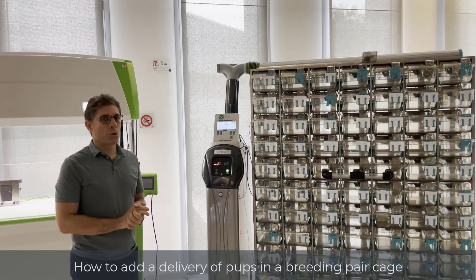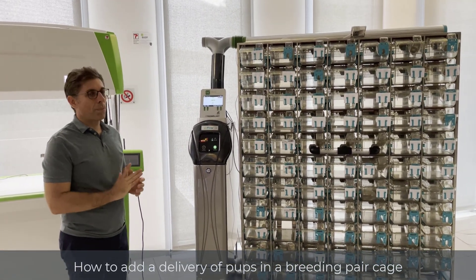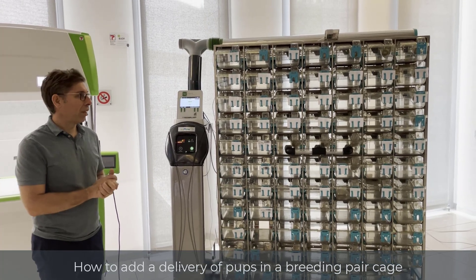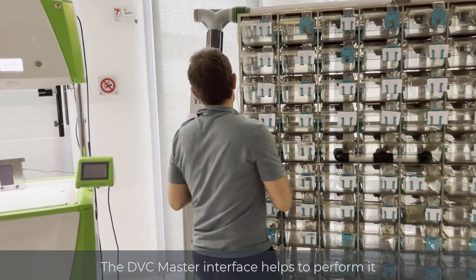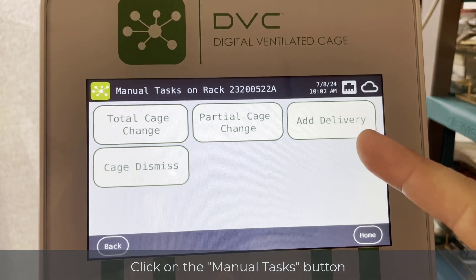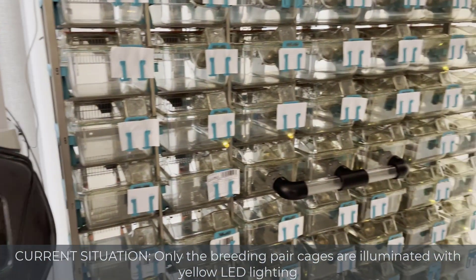In case you want to manually handle the potential delivery of pups in breeding pair cages, there is the opportunity to do it manually — whether you are anticipating the outcome of the temporal algorithm for breeding cages or simply handling these cages manually. There is still an opportunity through the DVC master interface by going under the manual task section, clicking 'Add Delivery'. Only the breeding pair cages are illuminated in yellow.